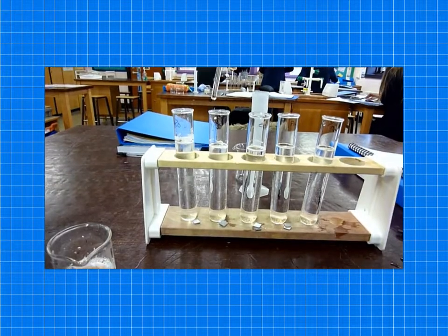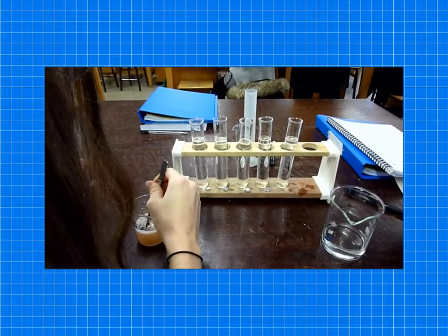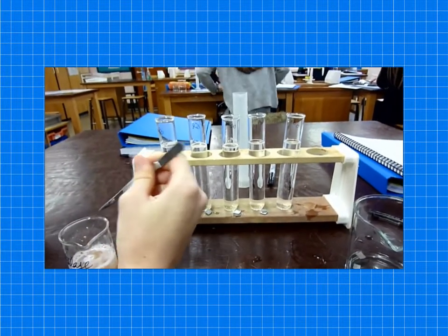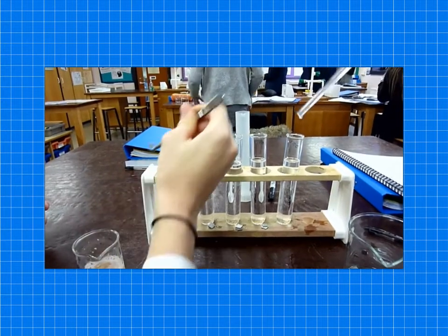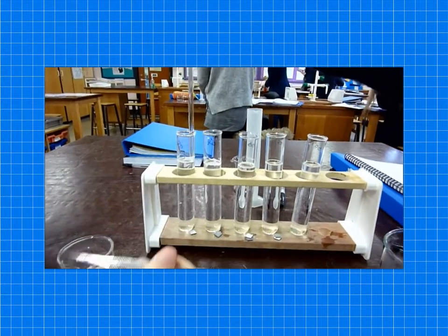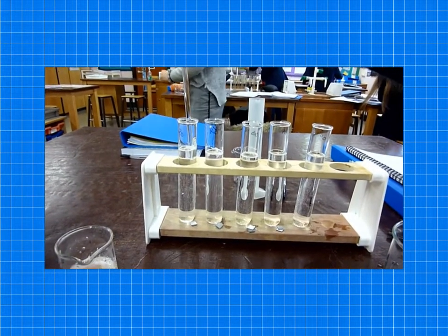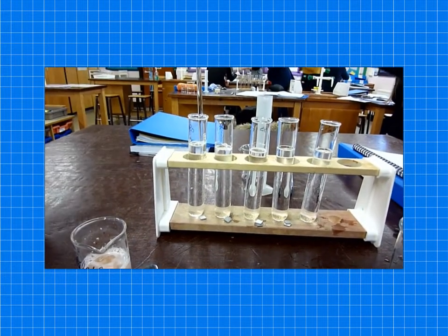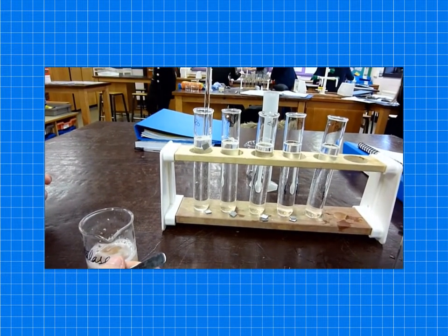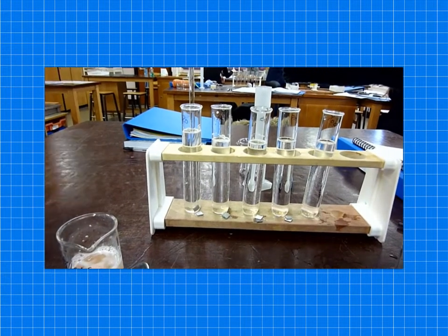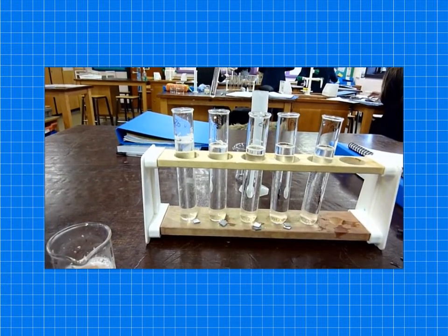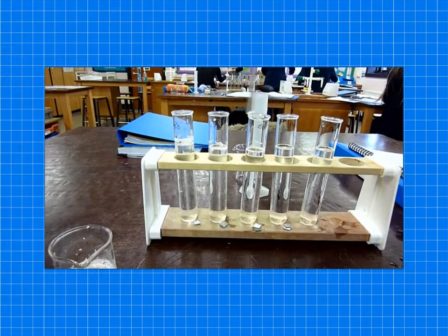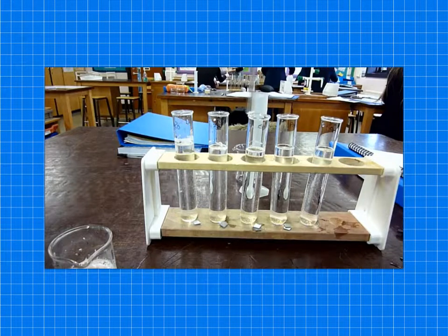This next one is 20%. So you can see them taking out the catalase, dipped it down, but never mind. Watch it very carefully once it gets to the bottom. You can see it comes up at a slower time.